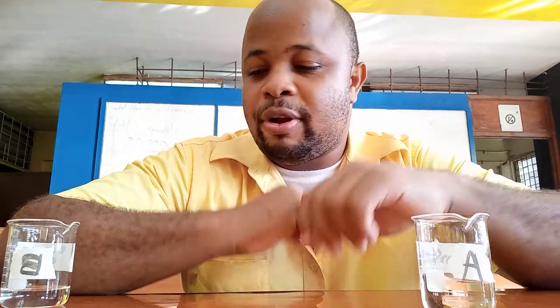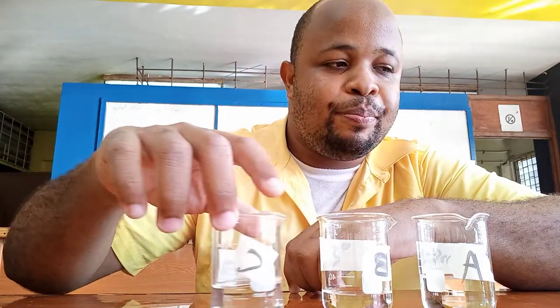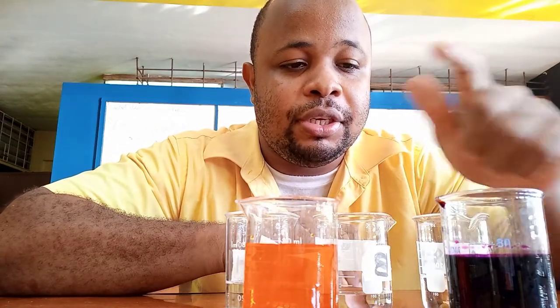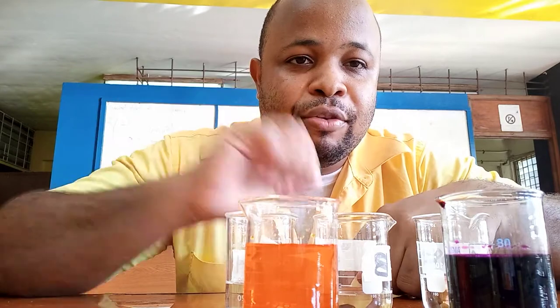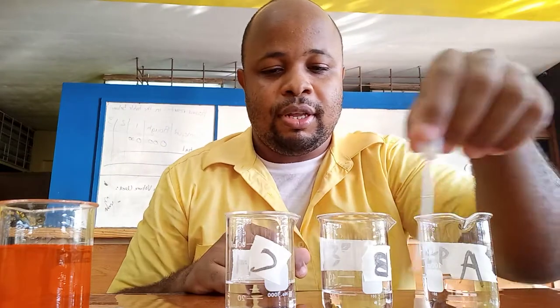We have three types of alcohols: primary, secondary, and tertiary. Primary and secondary alcohols can be oxidized by potassium permanganate and potassium dichromate, but the tertiary one will not be oxidized. With sulfuric acid as the catalyst, potassium permanganate changes from purple to colorless, and the dichromate changes from orange to green. The one where we don't observe a reaction is the tertiary alcohol.